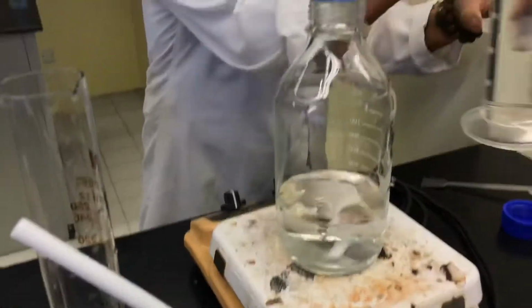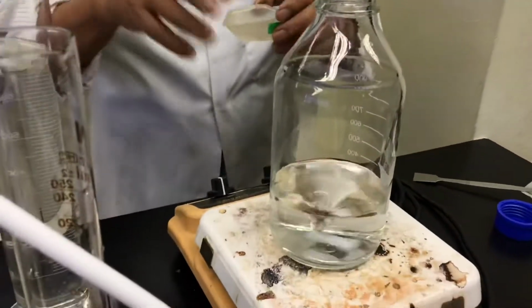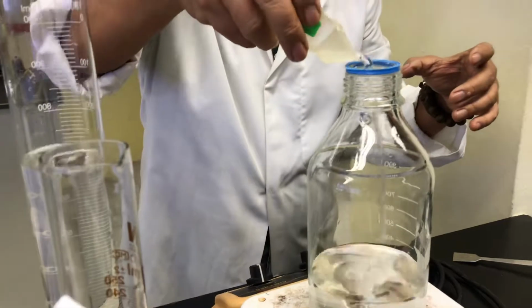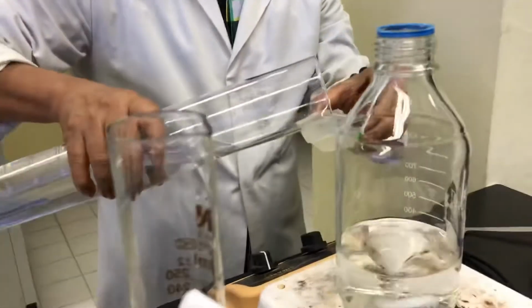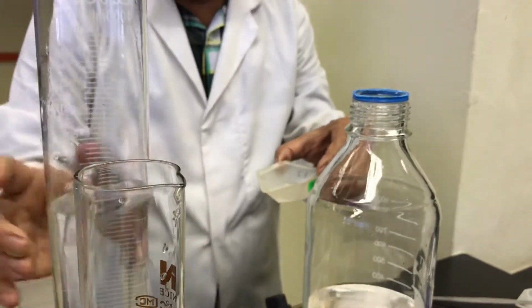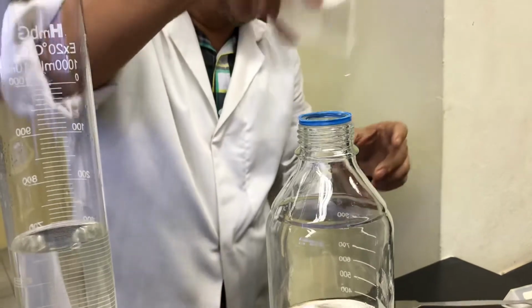Sorry, this is the water. You have to rinse. You can rinse, yeah, you swirl a bit and then put it there. Make sure the 1000 ml is enough for all 6 to put in, and then you rinse your things.